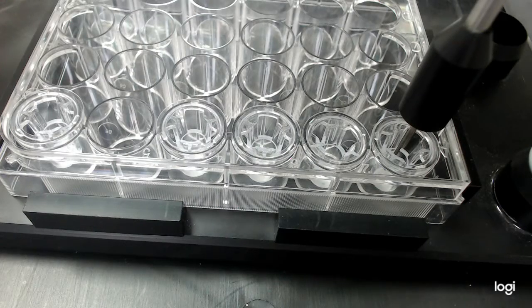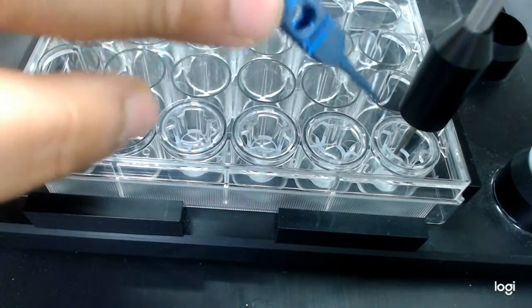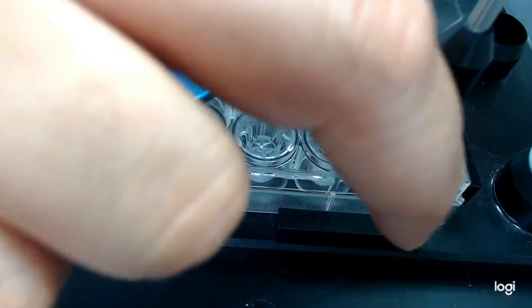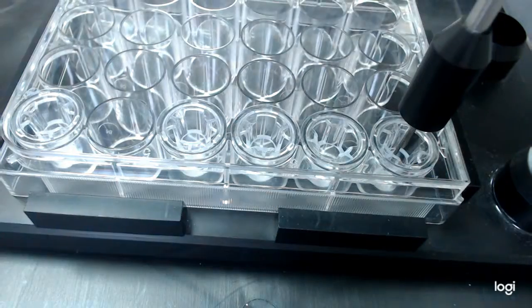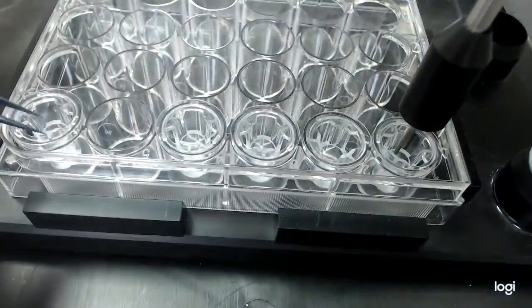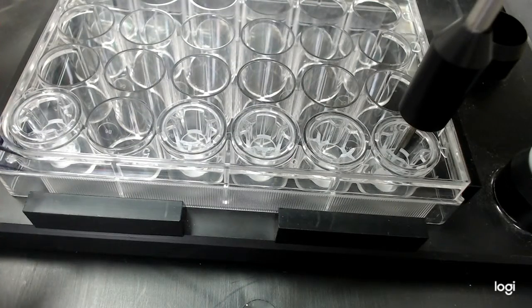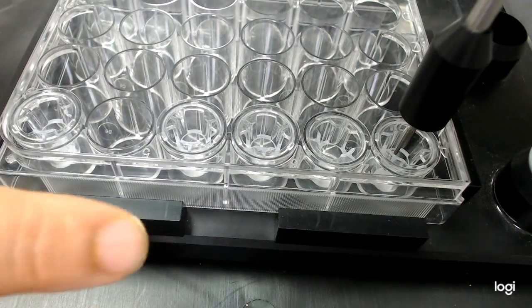However, there is a lot of risk associated with this. The reason is, as you can see, there is not a lot of room involved. The gap is pretty tight. And since the insert moves within the well, that creates a challenge. So let me try to explain it while I run the REMS software.